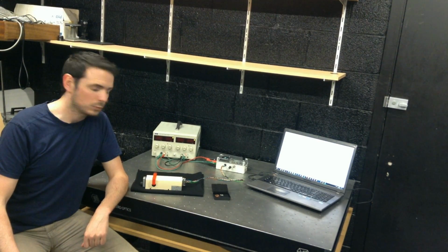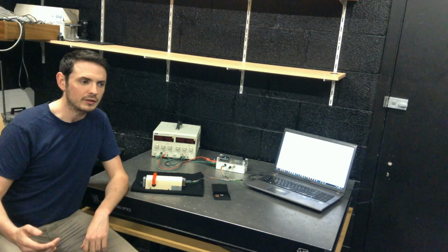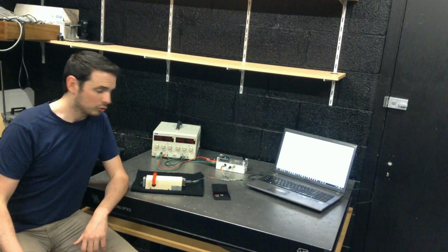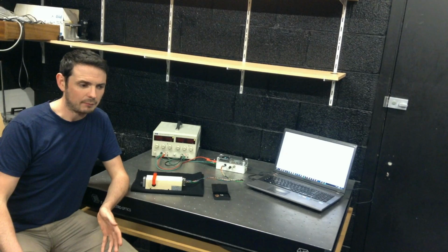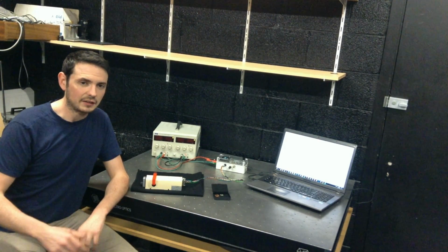was controlled by Arduino, which both controlled the motor position and digitized the output from the SiPM. The entire project was controlled using a GUI in LabVIEW, and that could show a live update of the scan that was actually happening.